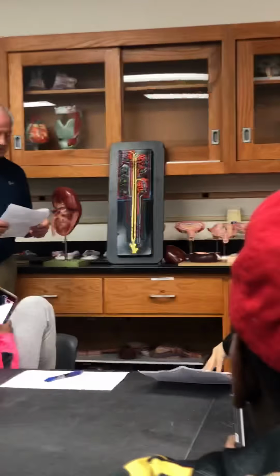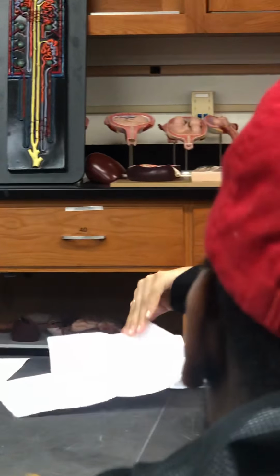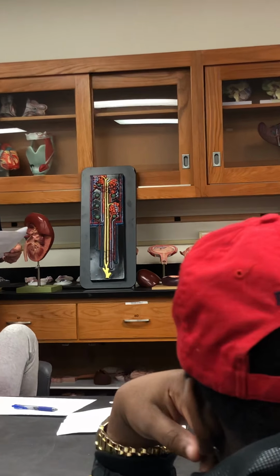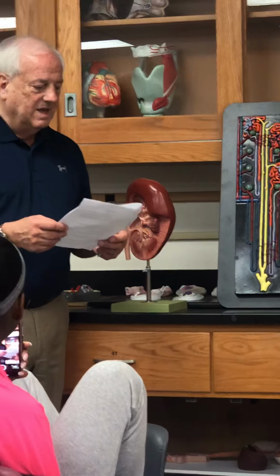There's still a lot of studying to do here. So all of these structures were named in this study guide, right? You'd make a copy for yourself again, it's on Canvas. Well, don't forget those babies over there. We'll get to those. Okay. Think they're part of the urinary system? Oh, female. Yes, I do. I'm just saying, we'll get to them.